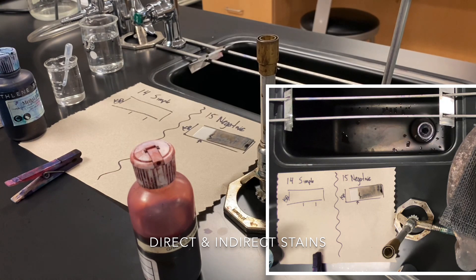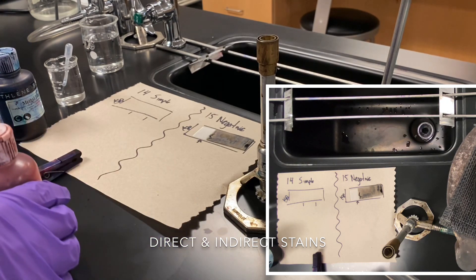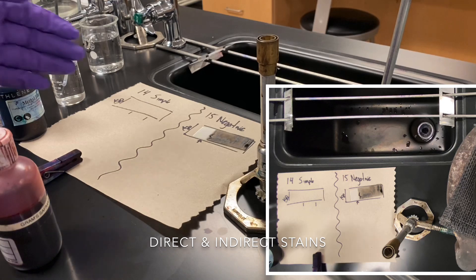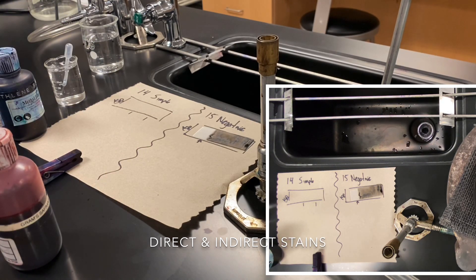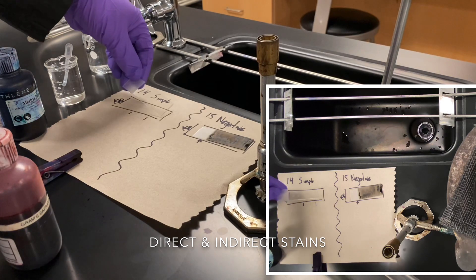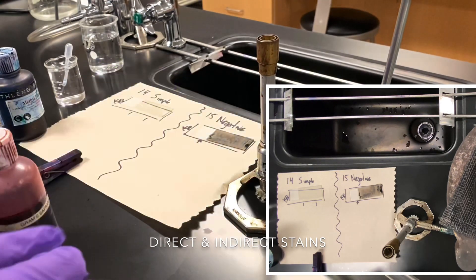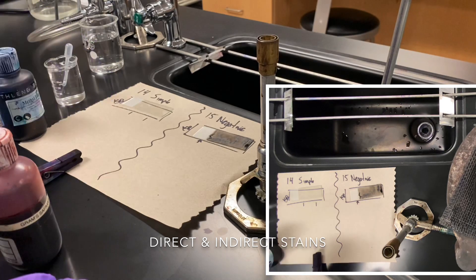Now that we've given time for the samples to air dry, you'll notice the negative stain is starting to look right — there's still a little bit to go. The simple stain has been placed on the bench heater to heat fix, which takes a little bit. Now we have both slides ready to go. I'm going to continue waiting for the negative stain to air dry completely, or at least mostly, and start staining the simple stain.